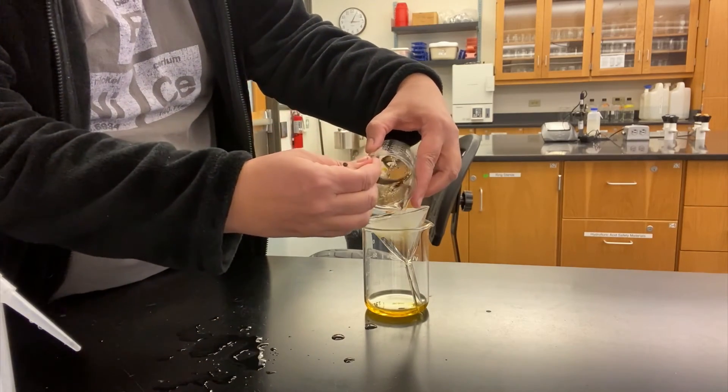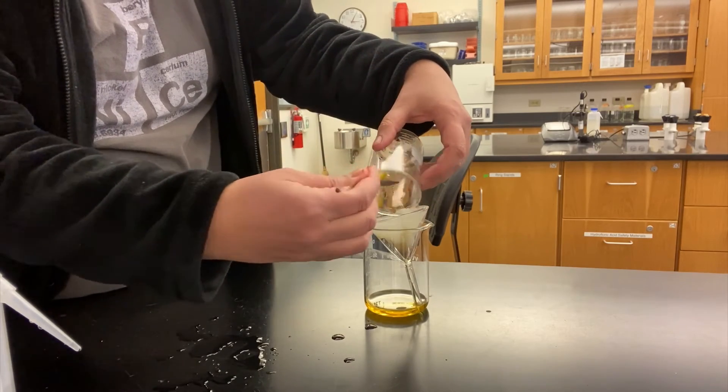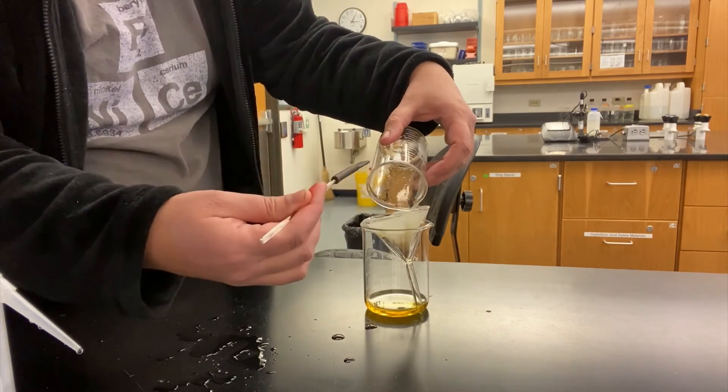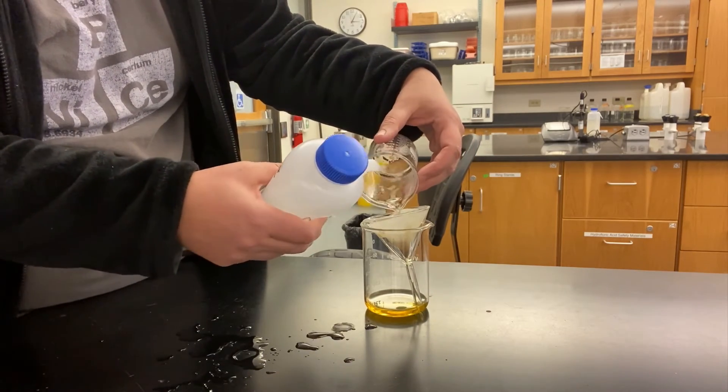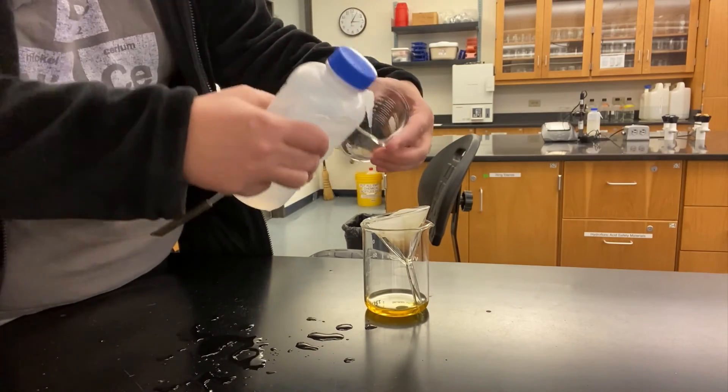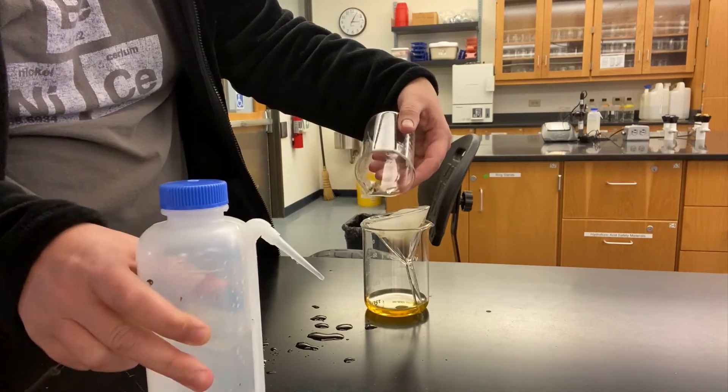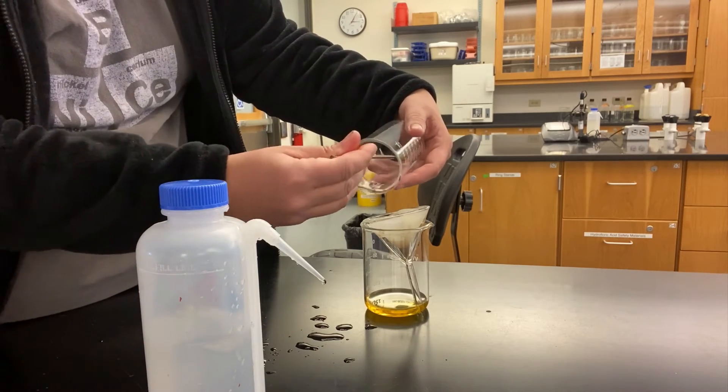After that, you can use the squeeze bottle to get what's left. You may have to alternate the use of the rubber policeman with a squeeze bottle several times to transfer everything.